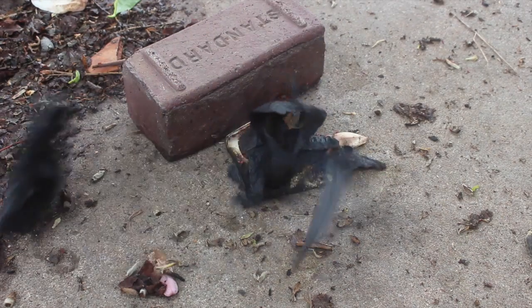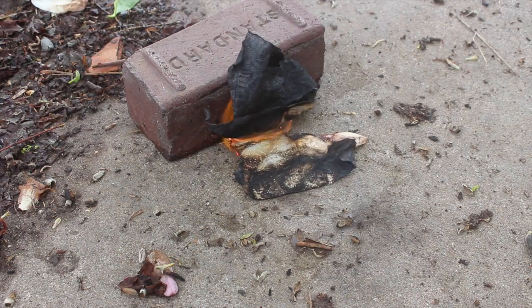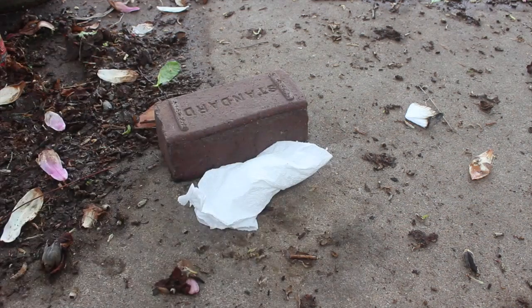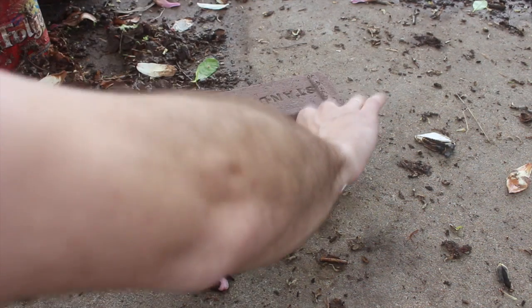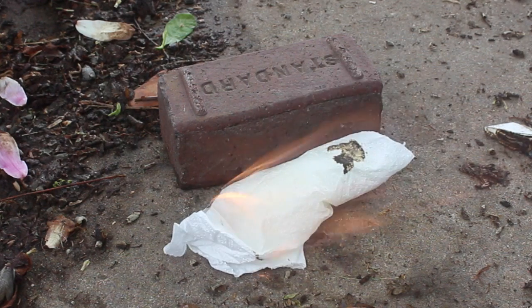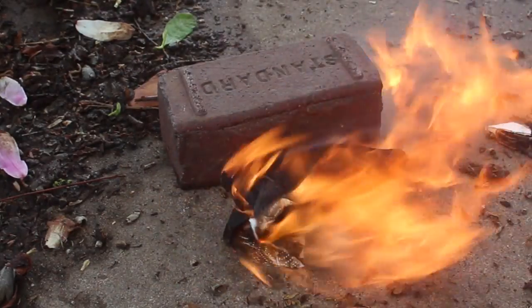You can hear how super windy it is, and even with all the wind this is a great way to start a fire — it's really good. We're gonna do that one more time, that was just too cool, we've got to see that again. We can make another fire. Ha! Success — we got a fire going now!